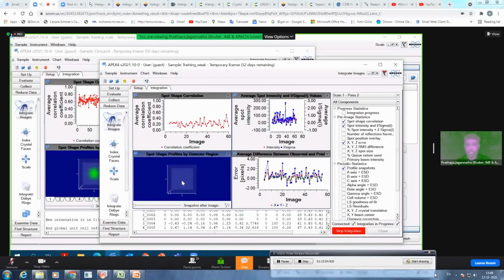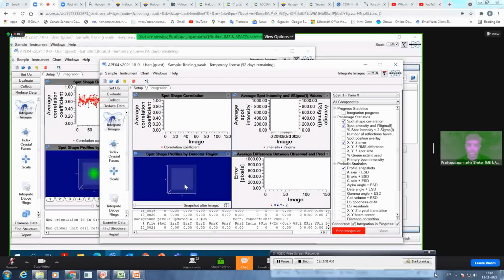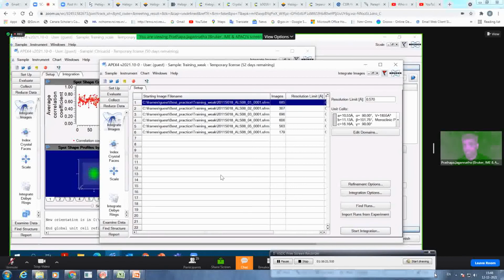So you can see already the model profile is showing white. That looks not great. And your correlation is 0. That means you're completely doing something wrong. This is an indication that either your unit cell is completely wrong, or your data is weak, but you need to see at least something, and you are seeing 0. So there is something wrong. Now I know I'm integrating up to a different resolution, so I have to correct this. I will put the correct resolution, up to 0.95, because it also has a massive influence on your overall parameters later on.